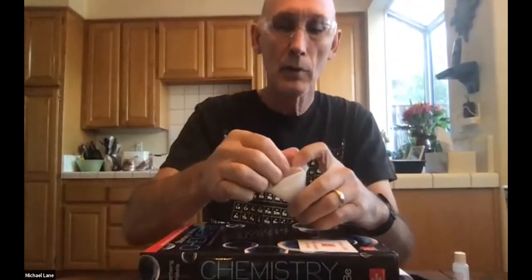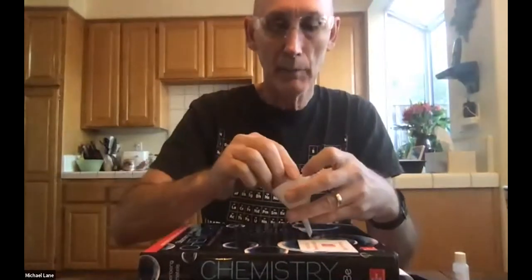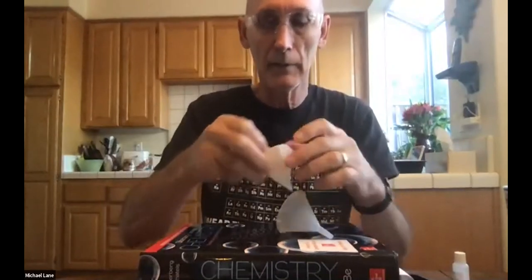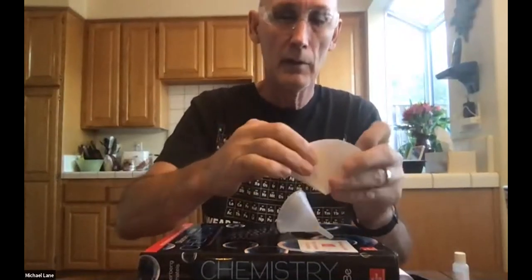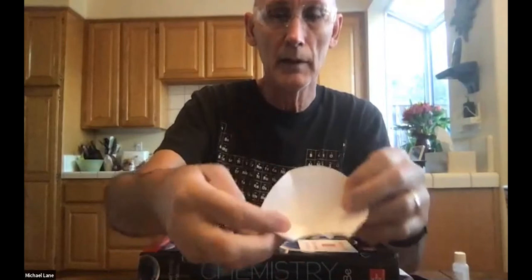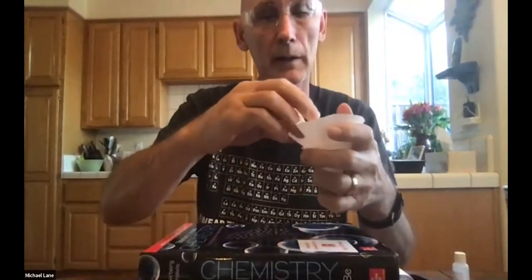So I've got it more or less set up. And this next part, I'm going to demonstrate, but you're just going to have to figure it out yourself a little bit as you go along. So again, I'm taking it apart and trying to get it in, and maybe if you can see, I'm grabbing one piece and folding it in so that I've got it like that. Let's see if I can get that in there. I might have to fold it again.